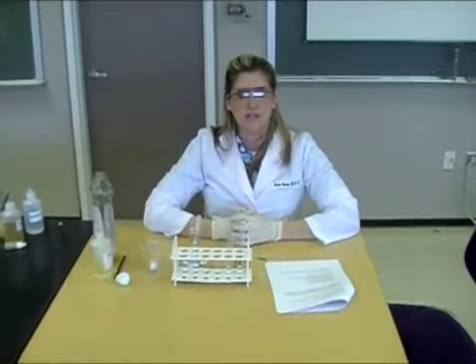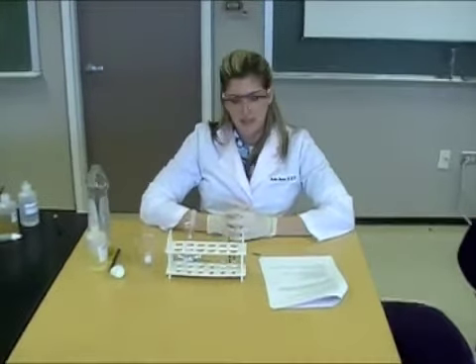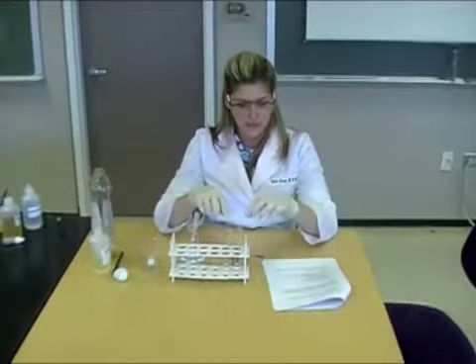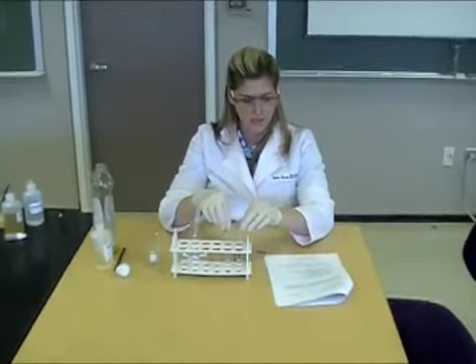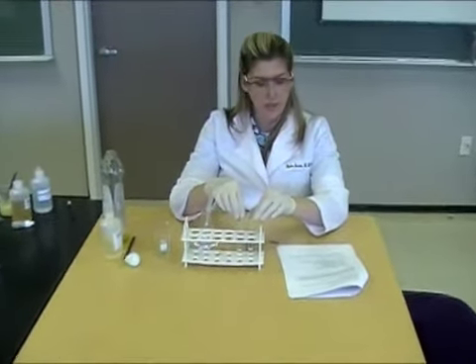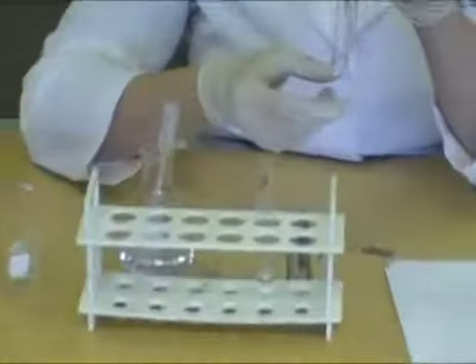In this segment, I'm going to show you the test showing the characteristics of lipids. You'll need two test tubes labeled 1 and 2. Mark each test tube at 1 cm and 2 cm from the bottom.